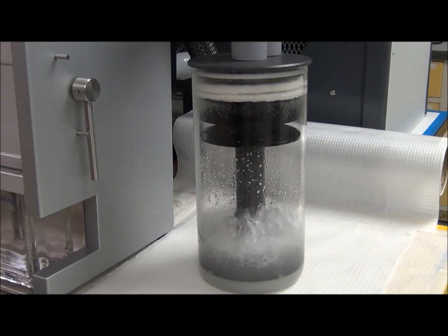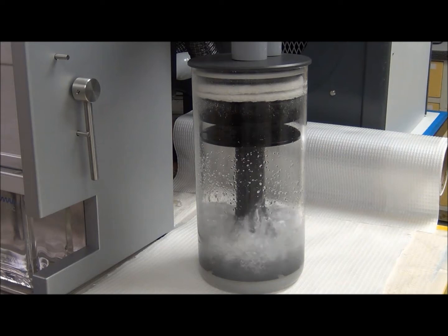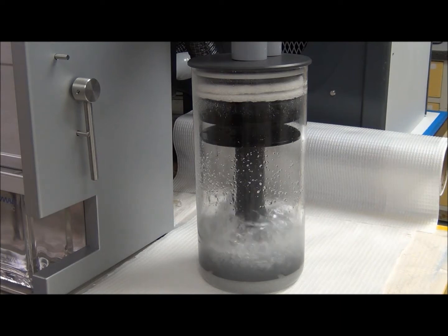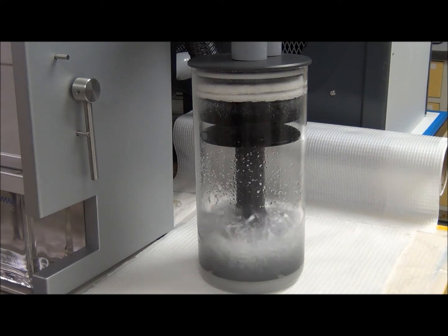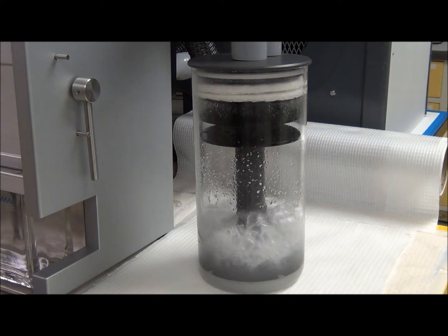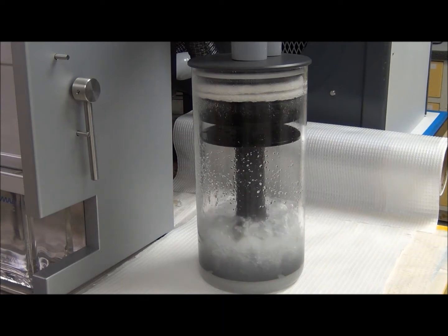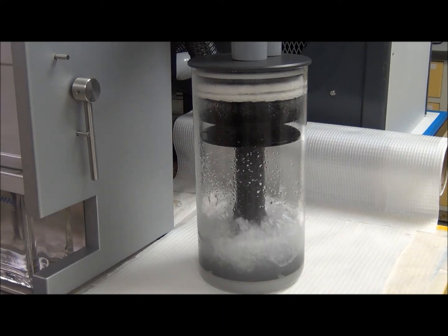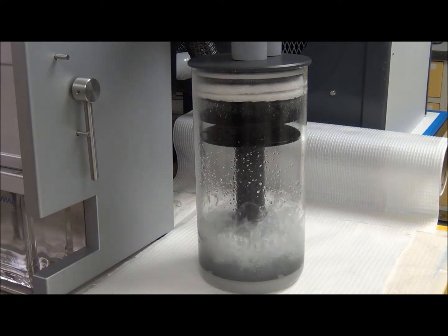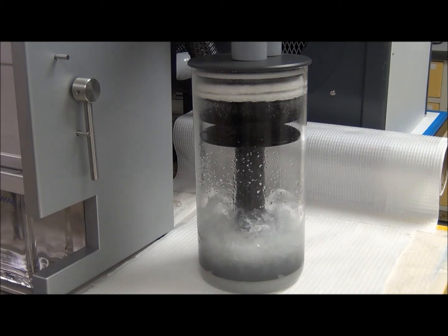Here you can see a better view of the humidity control process. Basically, there is a magnesium chloride salt solution inside the tank and air is bubbling through that solution and being circulated back to the plate. It's essentially a loop of air that goes around the plate, back through the humidity control solution, and back to the plate. Our method calls for 10 minutes of this, which gives it plenty of time to equilibrate and bring the plate to the proper humidity — in this case around 35 to 36 percent.